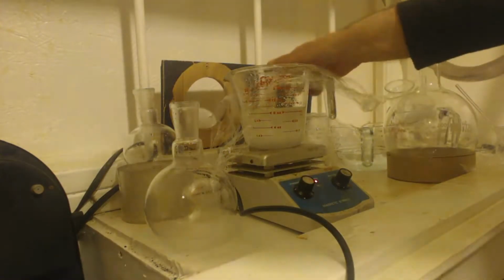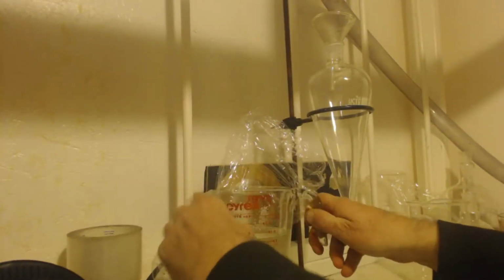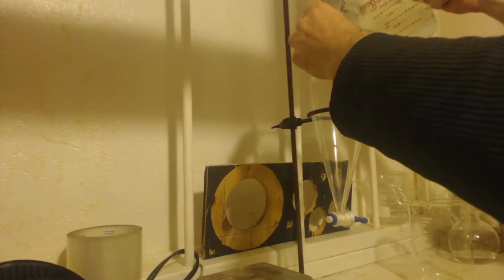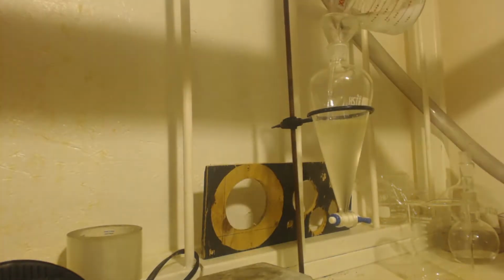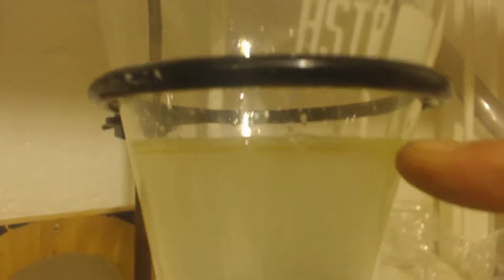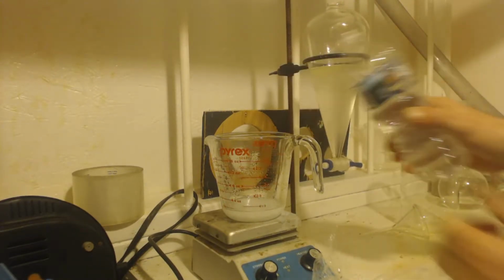Alright. I'll stir that for a while. So after stirring for about an hour, I let it sit for about a half hour. I'll pour most of it into this sep funnel. I don't know if you can see it, but here's the line. I'm going to put some water in here because I didn't get all the liquid out.